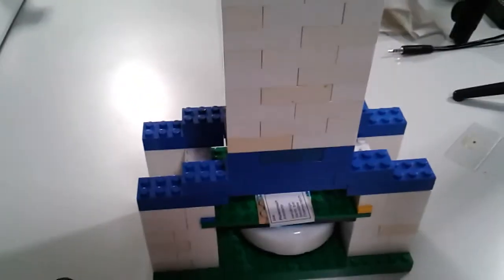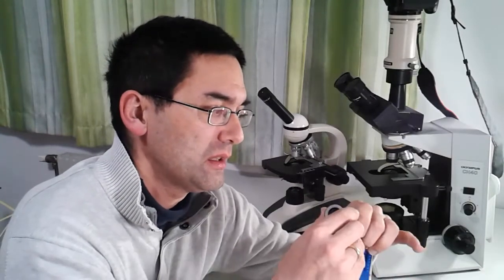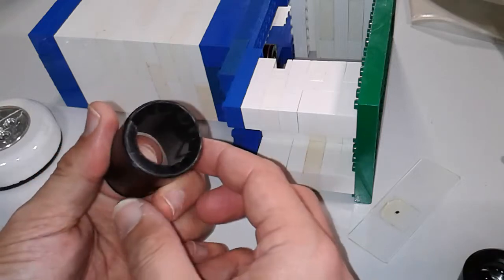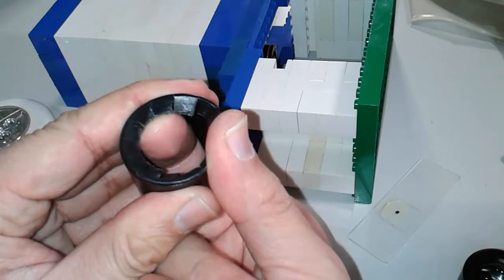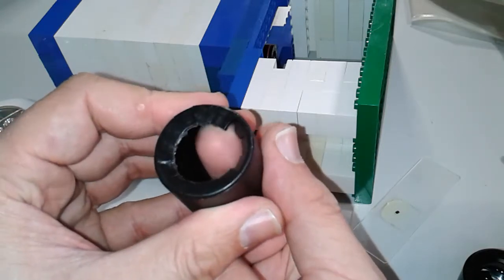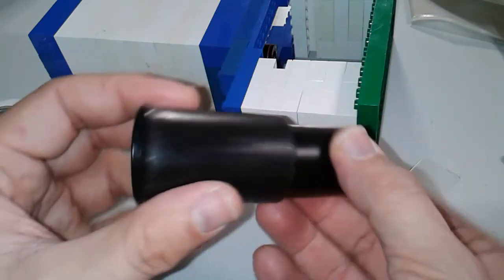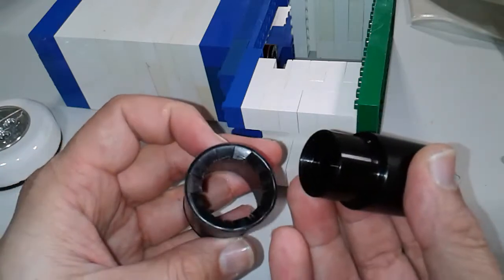So, how did I actually do that? First of all, you need two film canisters — I know they were popular quite some time ago; now you have to buy them on eBay or maybe you have some in your cellar. I cut out a hole here and bent it in like this, and then I could attach the eyepiece and move it in — it stays in there. These things sometimes even locked in, which was actually quite okay because it was a little bit more stable. So that is essentially the eyepiece. I can insert the eyepiece here in front and I can also move it in and out.